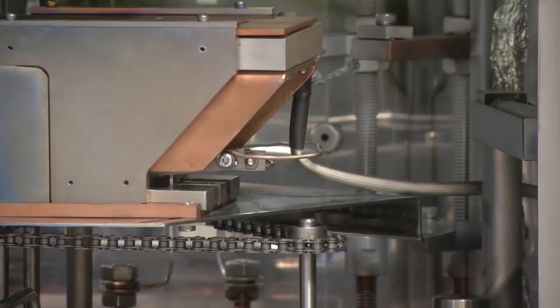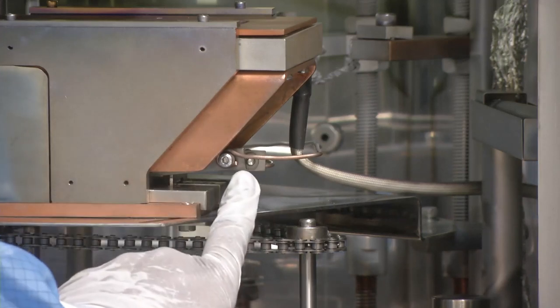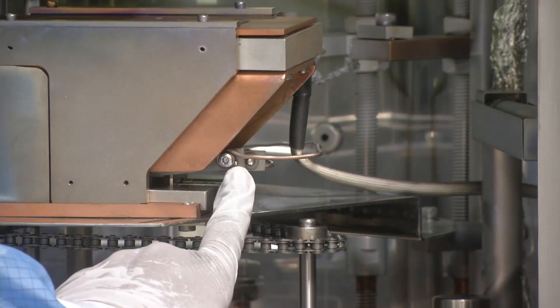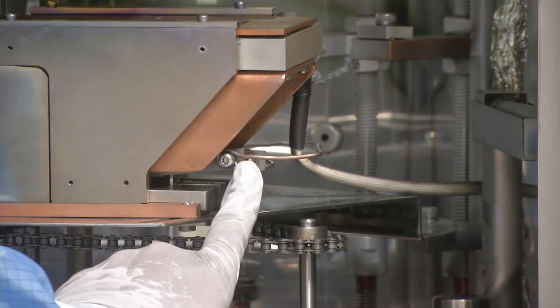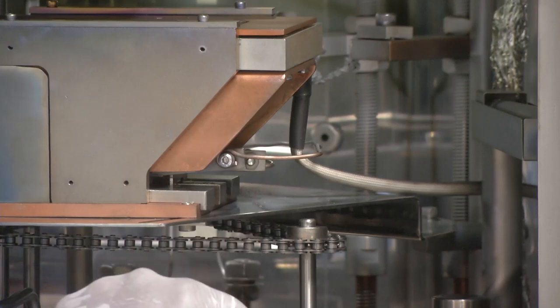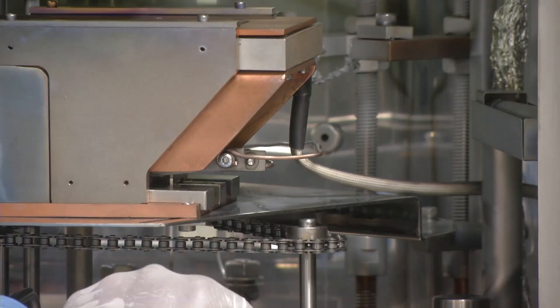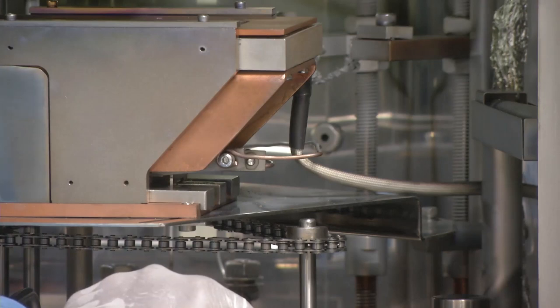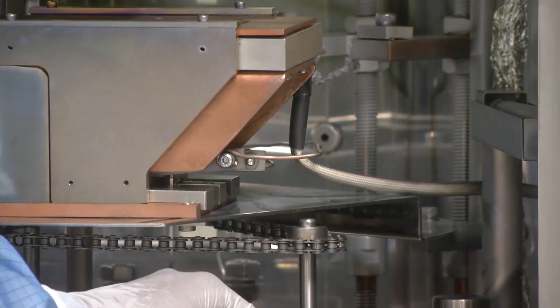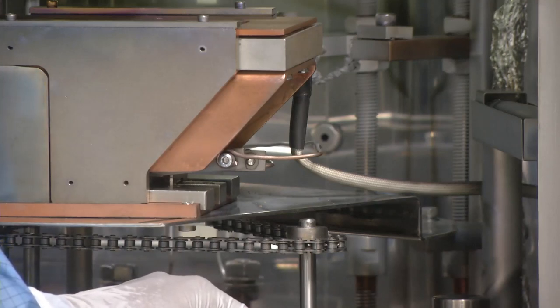The particular part we are looking at now is the filament. My colleague is indicating where exactly the filament is located. The material for a filament is generally tungsten. When a sufficient amount of voltage is supplied to the filament, it generates an electron beam — so in a way it is the source of the electron beam. Typical voltages are 3 to 5 kilovolts, which vary from system to system for laboratory research purposes.